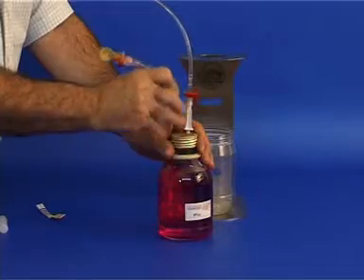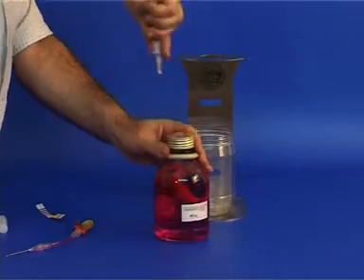Remove the bottle, remove the spike assembly and the syringe, remove the cap and the stopper.